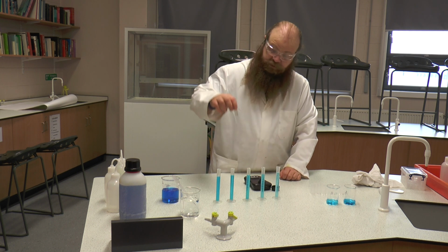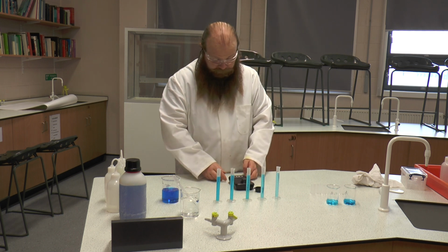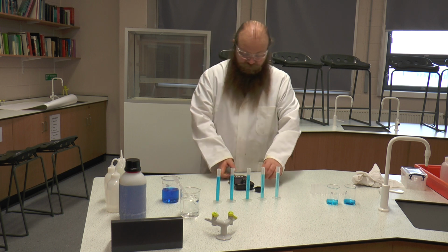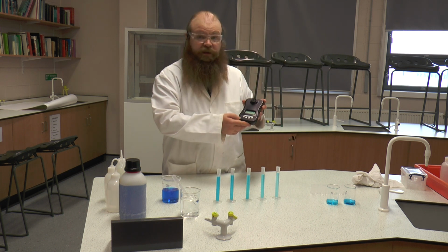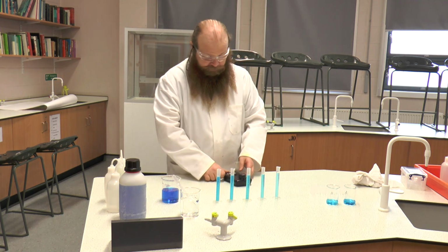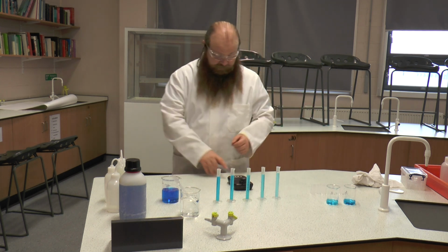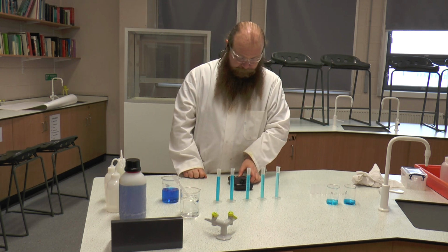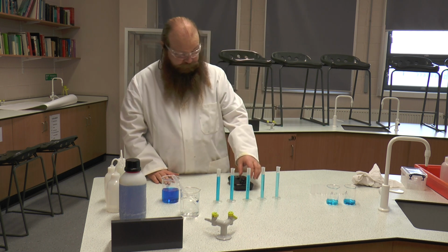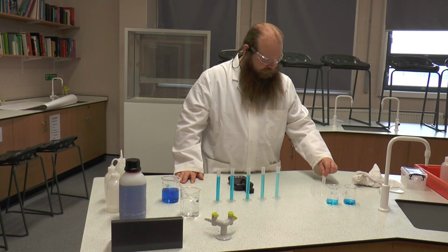So we're going to place our cuvette with clear sides left and right into our sample, and we're going to push the calibrate button. It should then read around about 100. Okay, it will either be 100 or 99. We can place the lid on as well if we wish, just in case they were in a bright room and it may affect the reading. Okay, and this one's reading 100. So we're going to do that in between each of our samples.